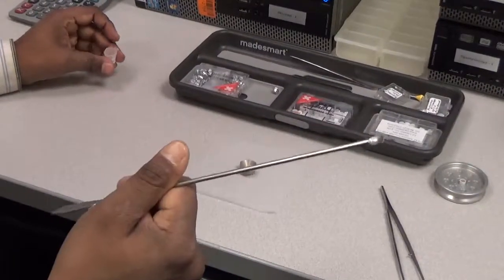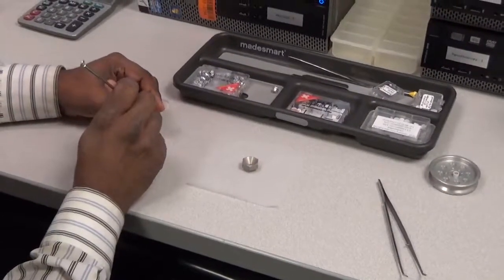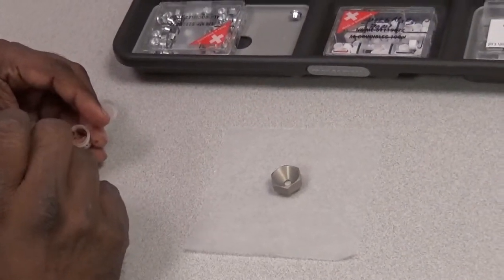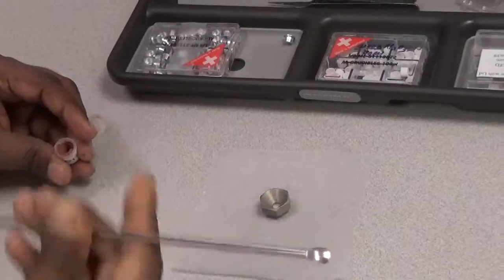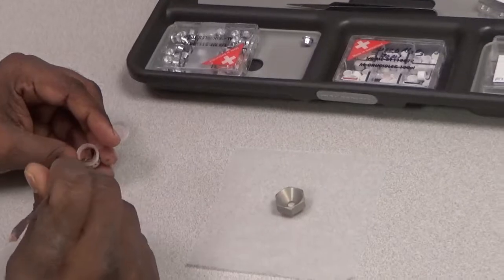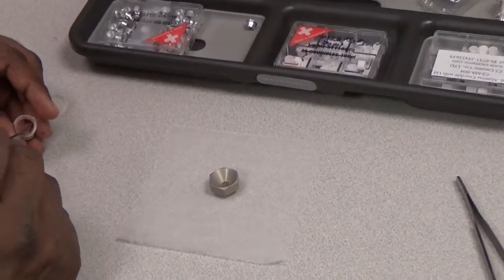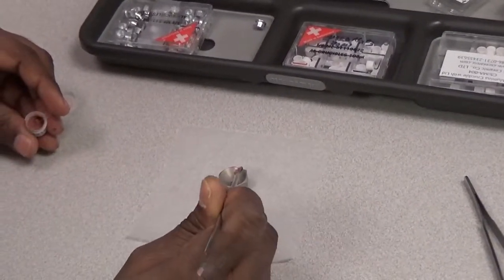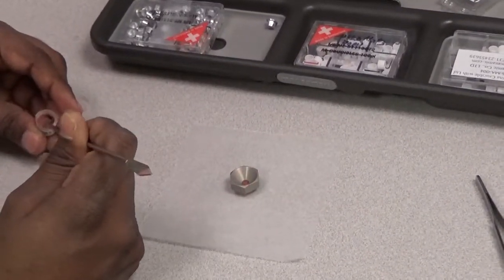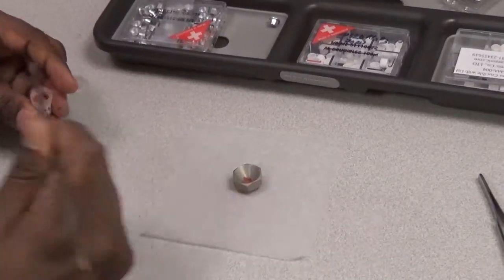We use this micro spatula — one side is pointed, another side is curved. First we make sure we mix the sample thoroughly to get a homogeneous representative sample. After we mix it thoroughly, we take the spatula and pick up very little sample — not much, just a little. We load it in the crucible. You need like 30, 40, 50 milligrams. That's it.